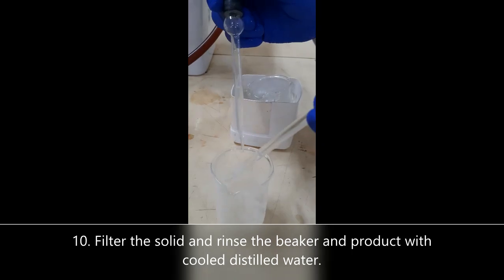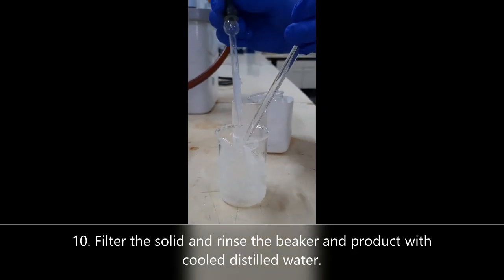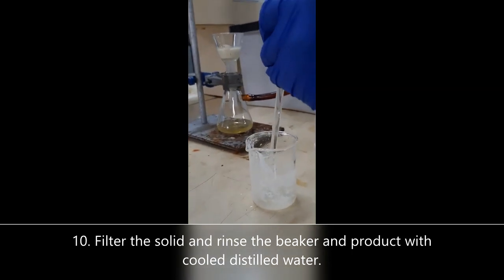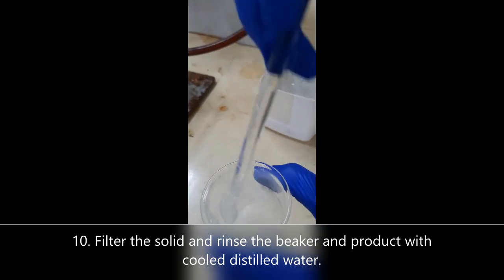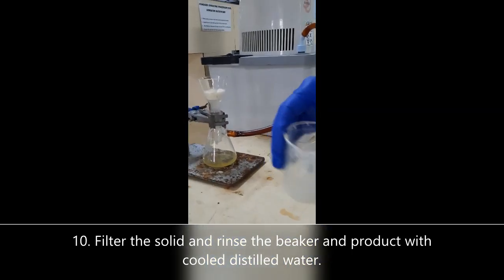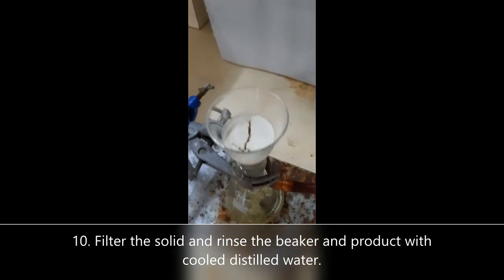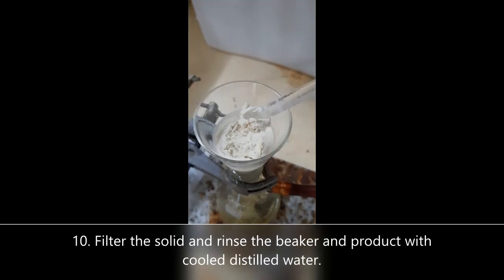Rinse the glass rod and beaker of any remaining solid using cold distilled water. Leave the solid to dry under vacuum in the Hirsch funnel.